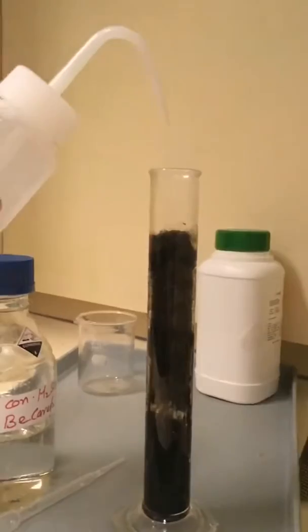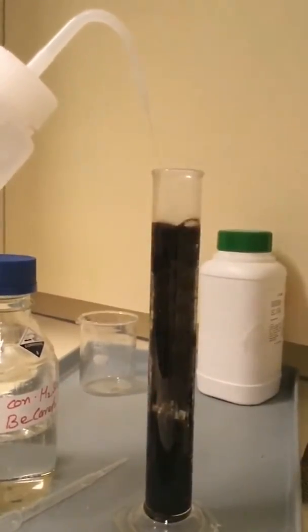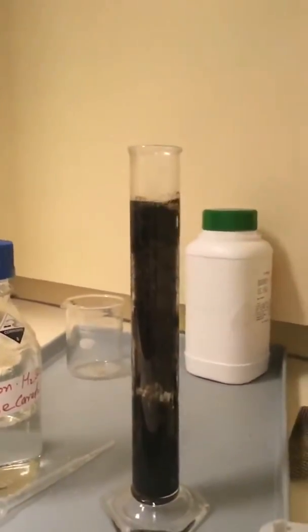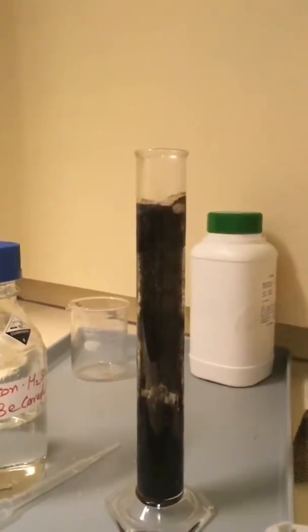A little bit of encouragement, we'll get the poo out the top of the measuring cylinder. There, there we go. Oh, come on, you can do it more today.